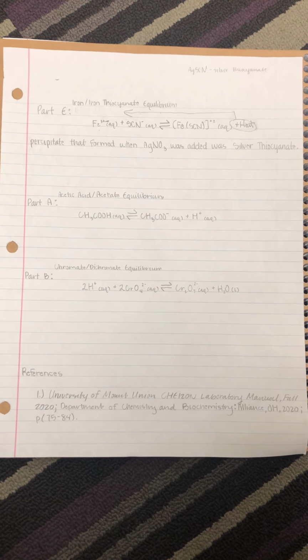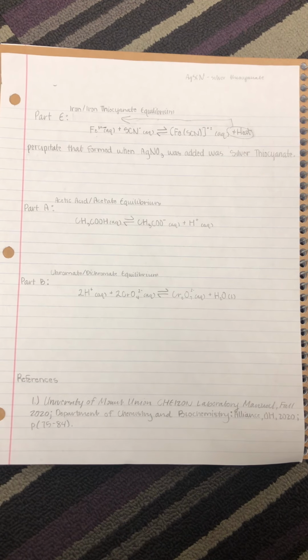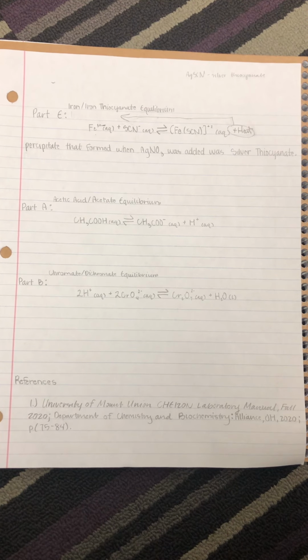Hi everyone, welcome to a video report for Chem 120 lab reviewing equilibrium. Let's get started. We will begin with part E of the lab. For part E, this is a reaction between iron and thiocyanate, the iron thiocyanate equilibrium.